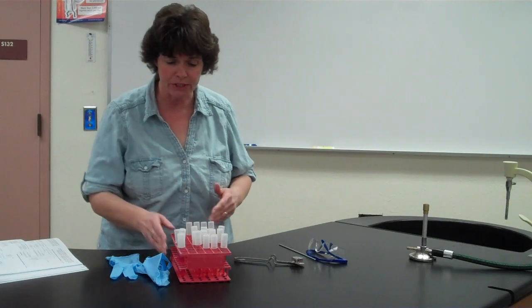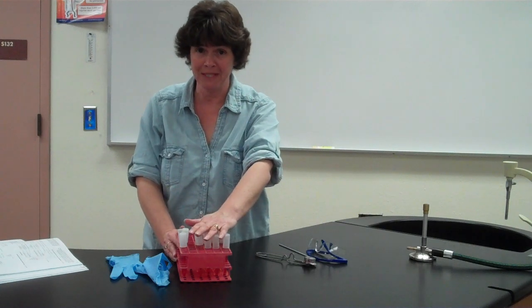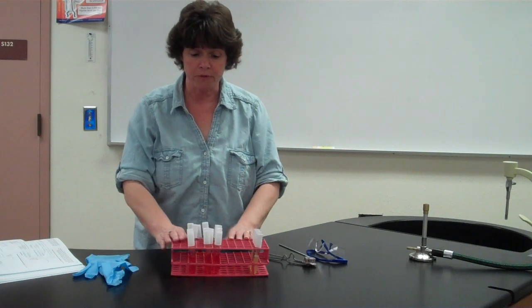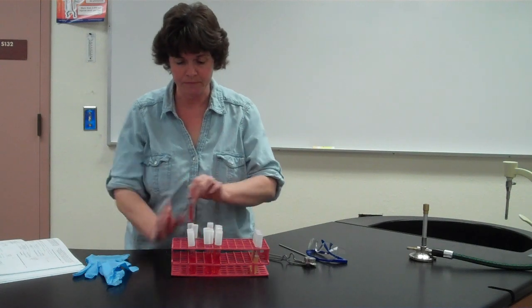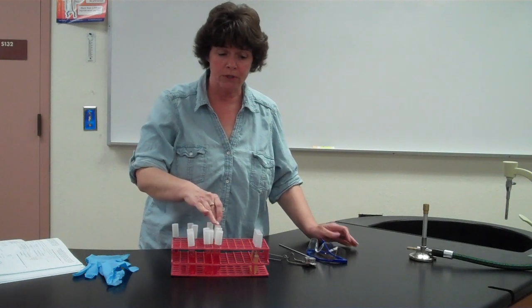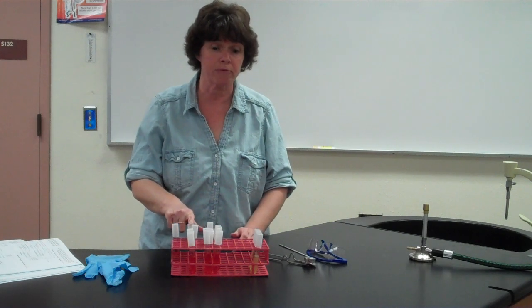For the fermentation test, you're going to have 15 media tubes and then you're going to have your 4 bacteria. So make sure that you have the right amount of tubes. With the 15 tubes that we have, this one's extra. You have 4 that are going to be used to put the bacteria in, and you're going to have 1 control for each type of sugar.